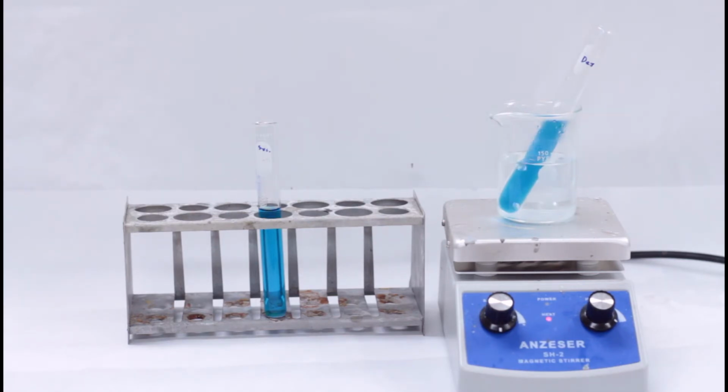One important factor to note is that in chemistry, we often have qualitative tests and quantitative tests. In this lab, we're going to be looking at a qualitative test, and the difference between those is that in a qualitative test, we're just concerned if something is or isn't. For example, the sugars we're going to test in this lab, one of them will have a reducing component and the other will not. That's all we're testing for. We're not testing how reductive is it, we're just testing whether it is or isn't.